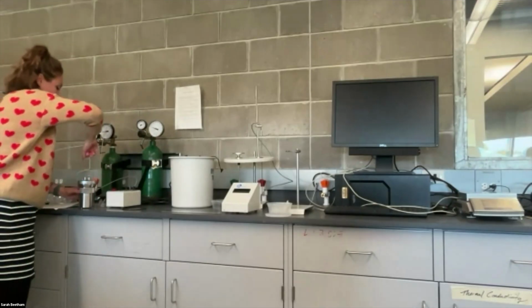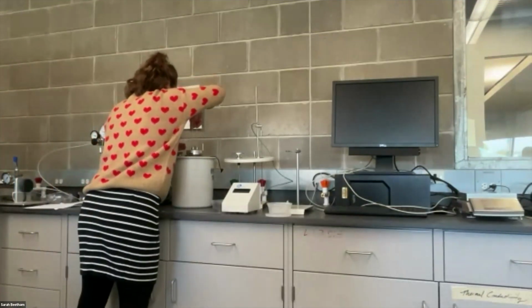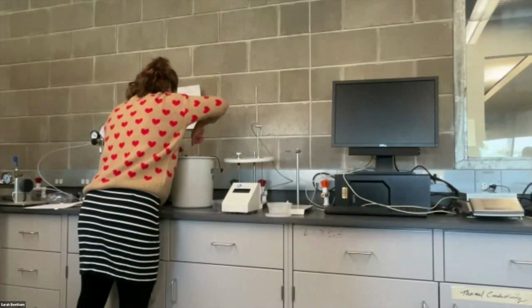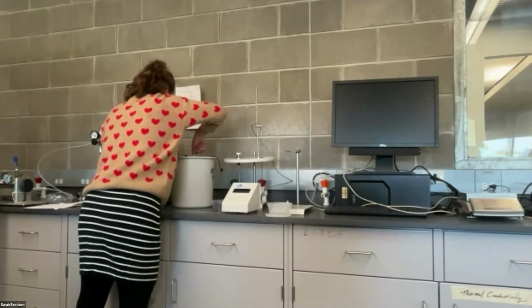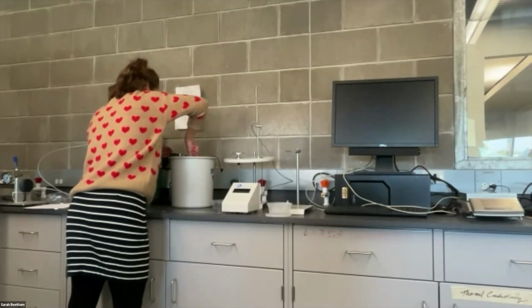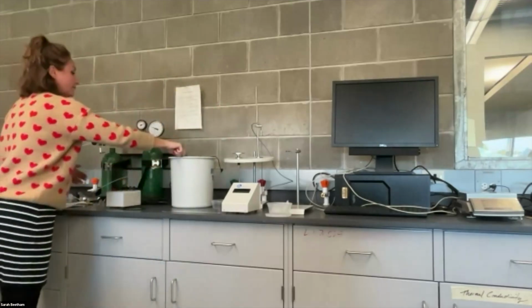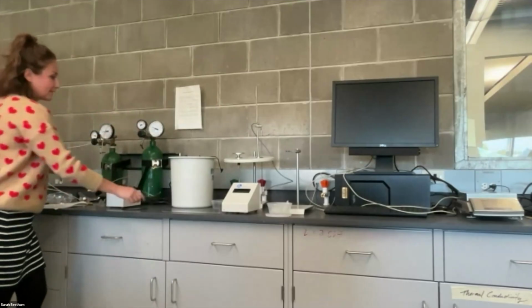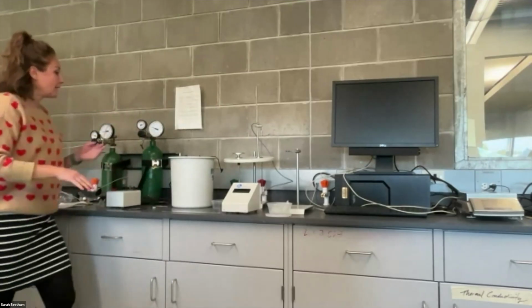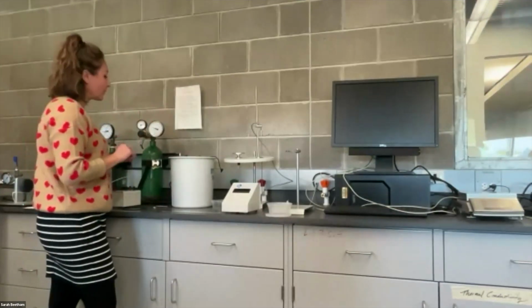So we're gonna just very carefully take it and lift it into the bath, and the bottom of this will line up with the little circle inside of here. Okay. Make sure you keep all the water inside the system, so if the tongs get wet, just kind of tap them off on the side. And then the entire bomb is going to be covered with water. That's by design, so don't be worried about that.